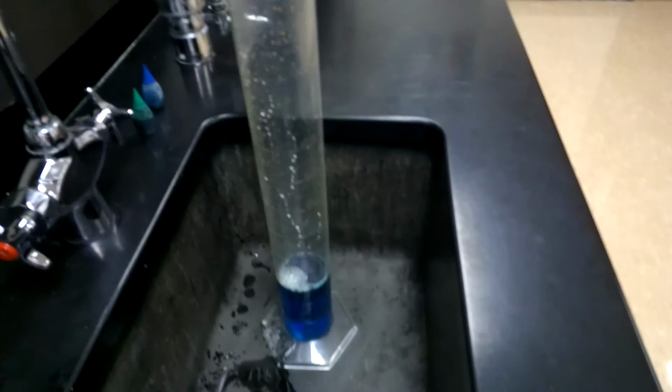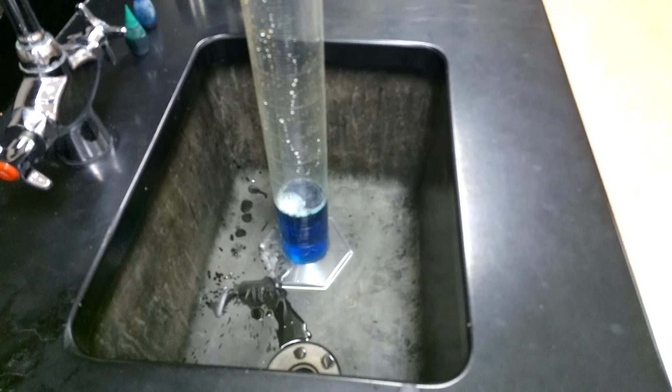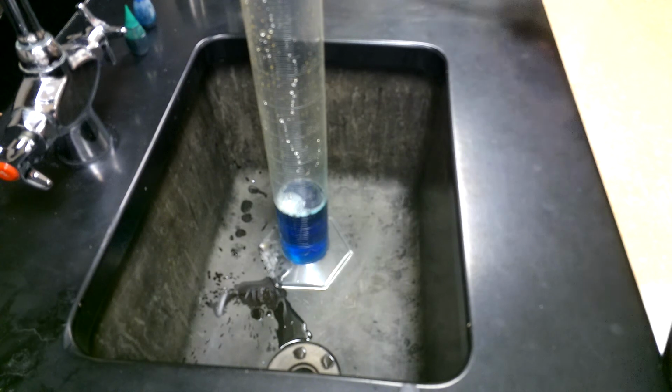In my second beaker here, it kind of looks the same. It's the same amount of liquid, just a different color. And this time, I have 30% hydrogen peroxide. This is the stuff you need to be a scientist to get your hands on. Not something you can typically get. And that means I increased my concentration of hydrogen peroxide.